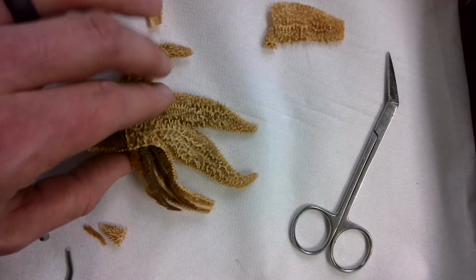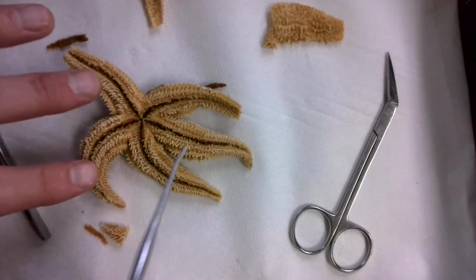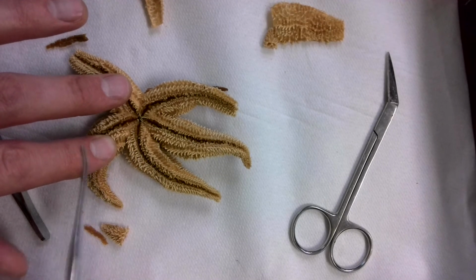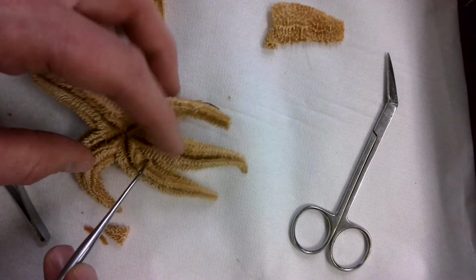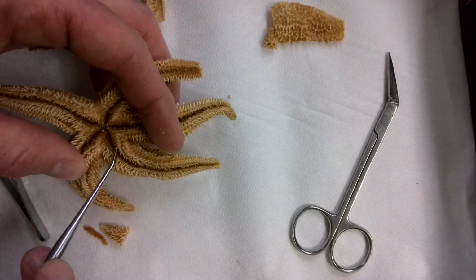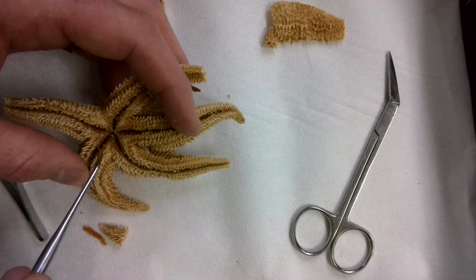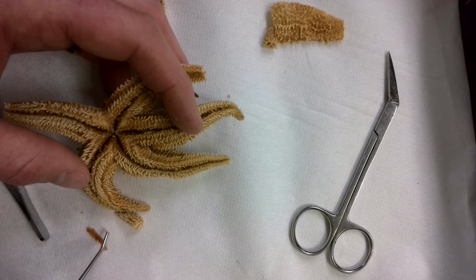So then when we look at the ventral surface of the sea star, we have our mouth right in the middle here. And then as you can see, my probe kind of slips down. There's a depression there. That's called the ambulacral groove. And then in the ambulacral groove, there's hundreds of little tiny sucker-like devices. These are called the tube feet. So when you watch Finding Nemo and you see the sea star that is attached to the side of the aquarium, it's attached using its tube feet. And those are another important part of the water vascular system that we'll discuss in a little bit.